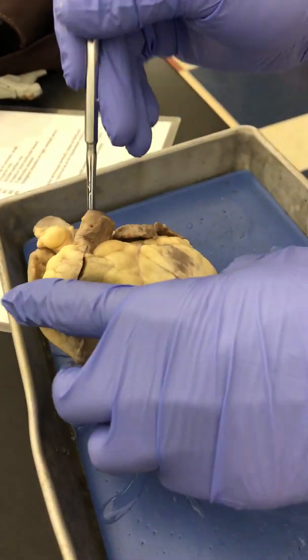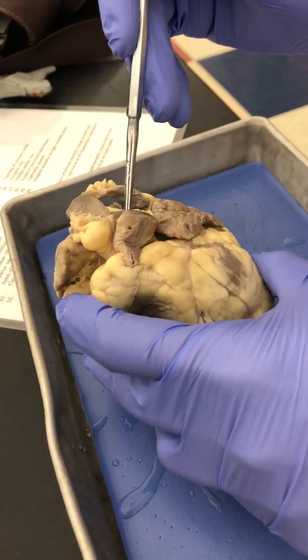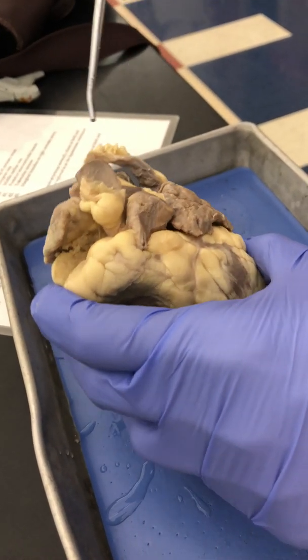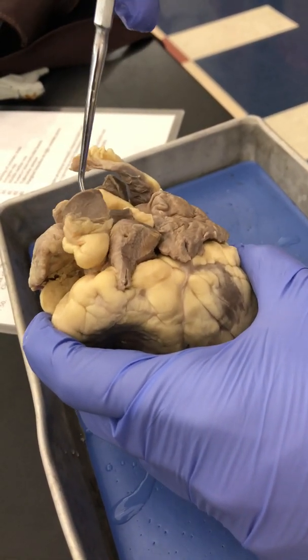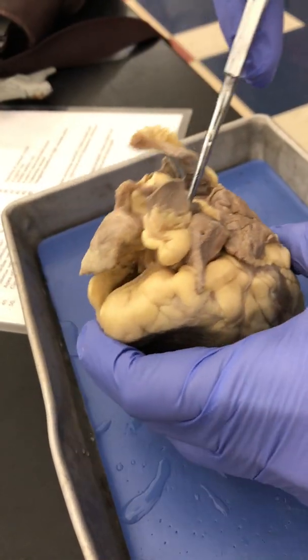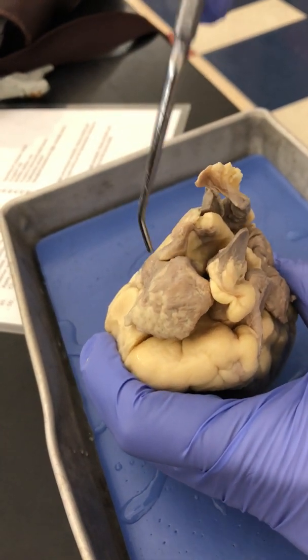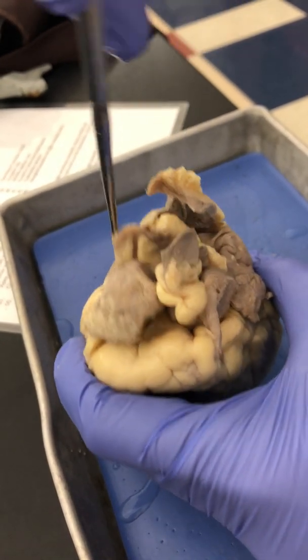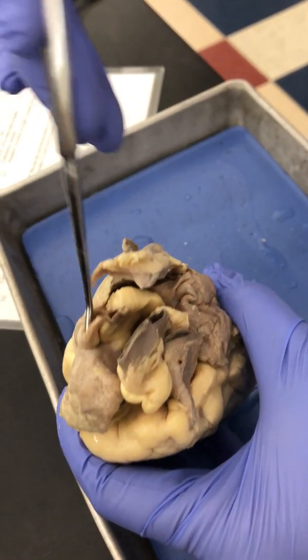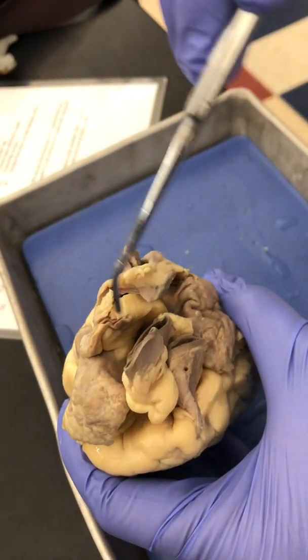The very first blood vessel that you see here, this is the pulmonary trunk that will eventually branch, but you don't see the branches here for the pulmonary arteries. This next tuft-like vessel that you see here, that's the aorta. The vena cavas dump into the atrium. This looks like it is your superior vena cava, and you can see that it is much thinner than the aorta coming out of the heart.